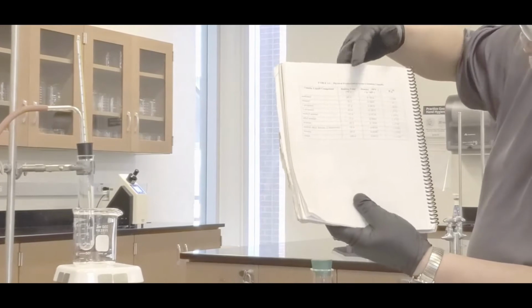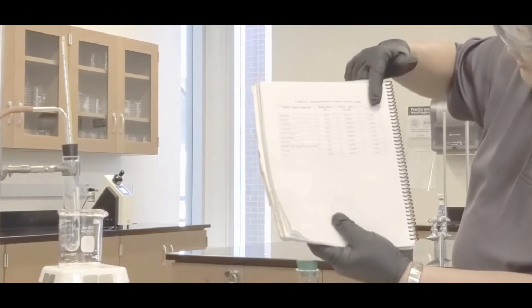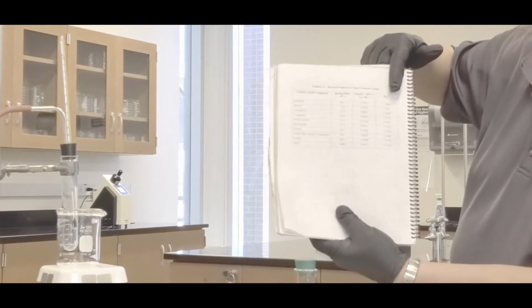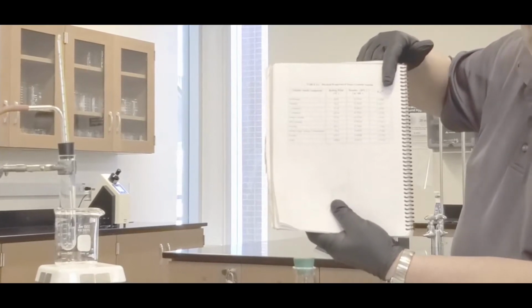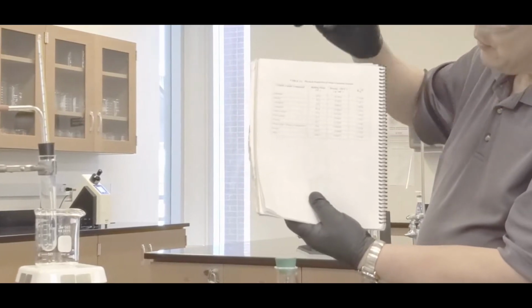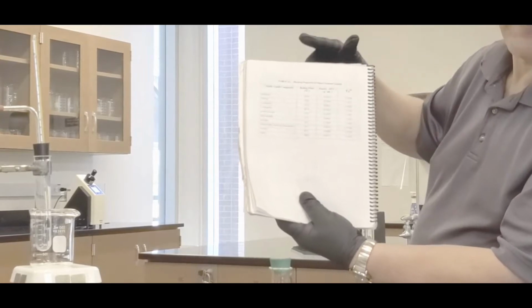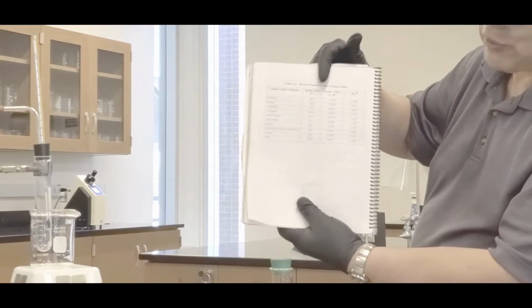And then, of course, we're going to use the boiling point, density, as well as the index of refraction to try to determine what that substance is. We're going to measure them. And if you have a substance that has several matches for the properties, that would be the most likely substance, okay?